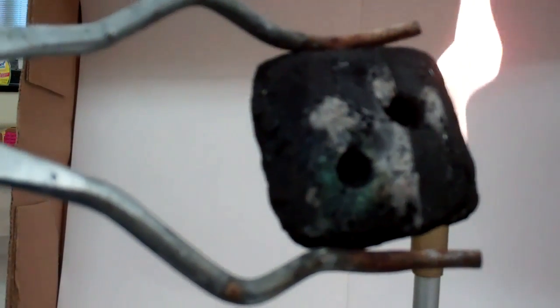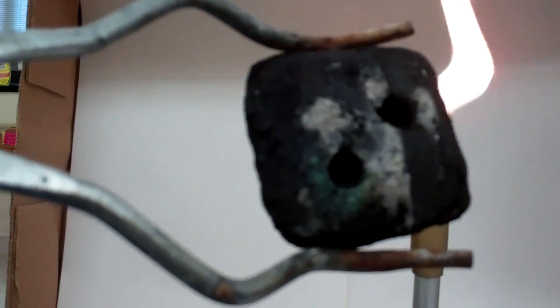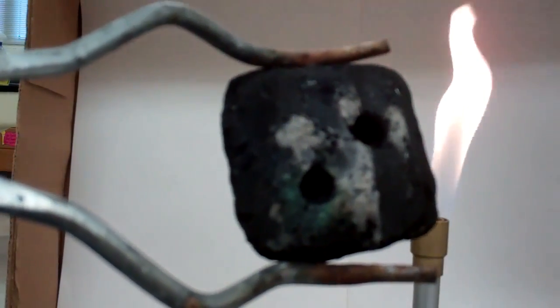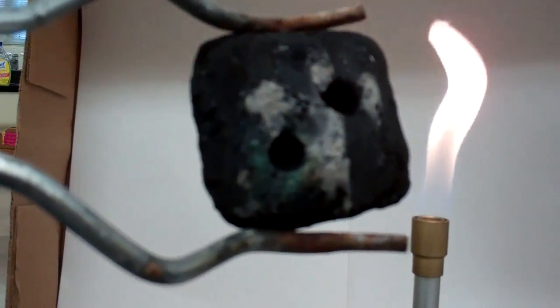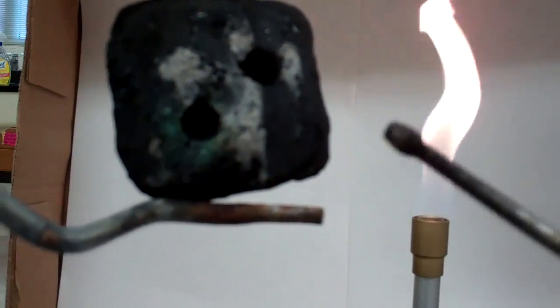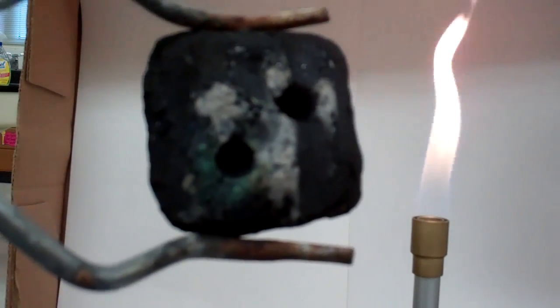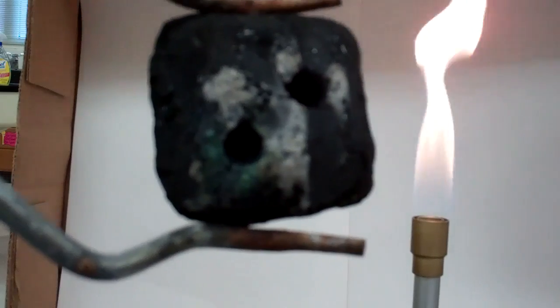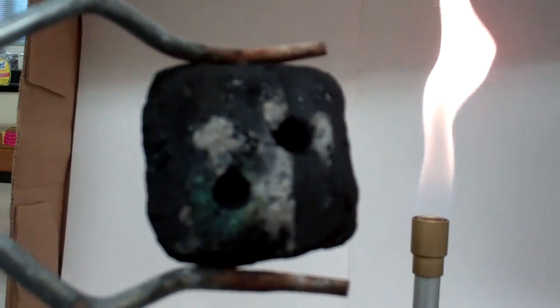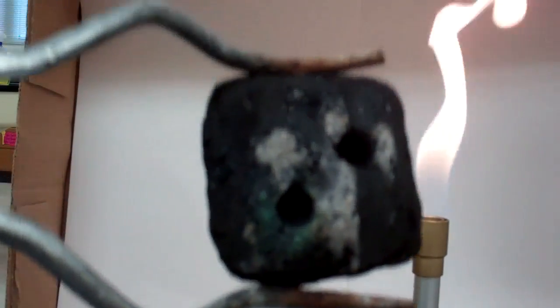Aluminum would then be the second and magnesium is kind of challenging to see that peach because as you can see the outside of the briquette changes to that charcoal gray color which can sometimes mask the peach color of the magnesium.